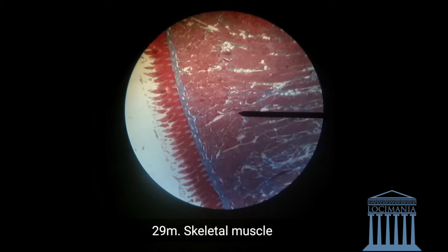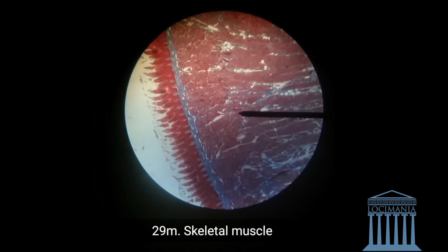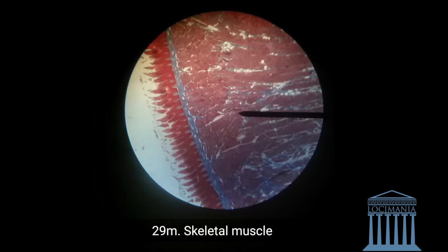Talking about the perimysium, we are now going on to the skeletal muscle which the perimysium was lining. Here we have the skeletal muscle — the red part of the specimen. The perimysium is surrounding the red part, which are the skeletal muscles of the tongue.